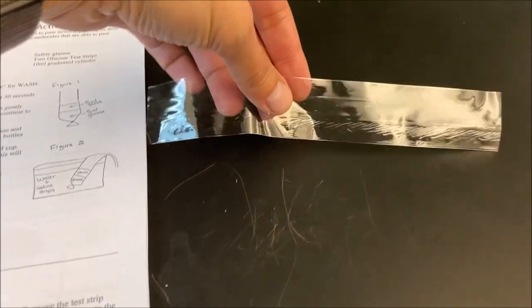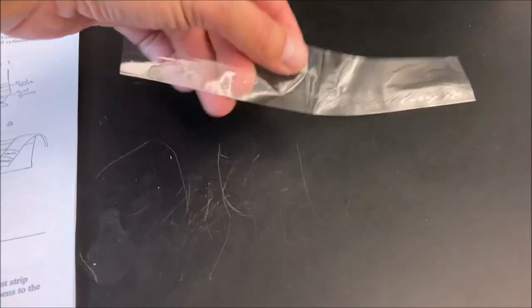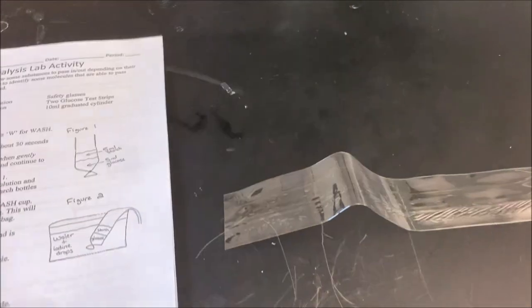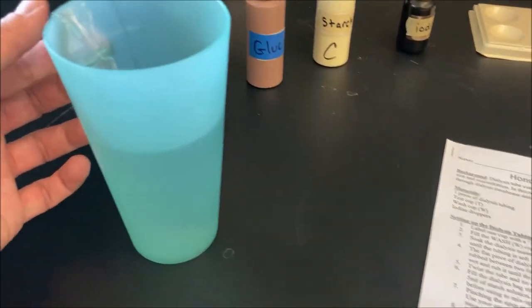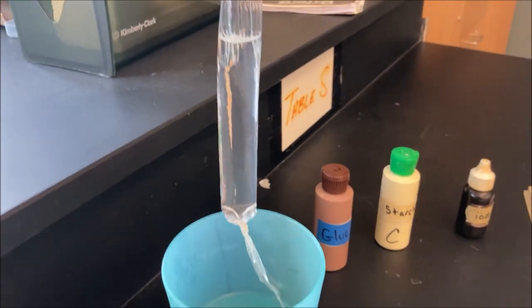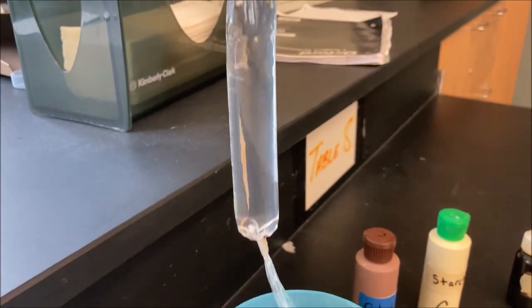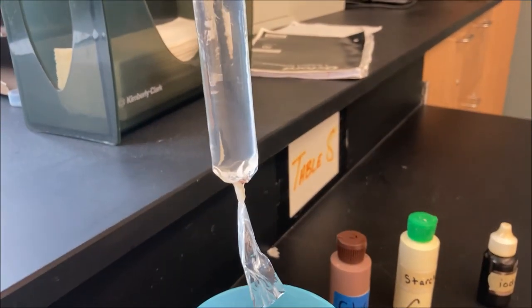What this is — it looks like a flat piece of plastic, but it's not. This is actually what is called a dialysis tube. If you get it wet and rub your fingers between it, you can actually inflate it. You can see I tied a knot in the bottom and added some water to show you that it actually is a tube.